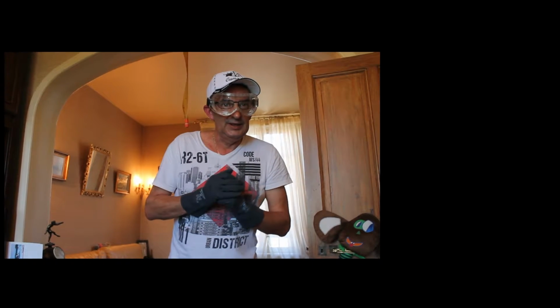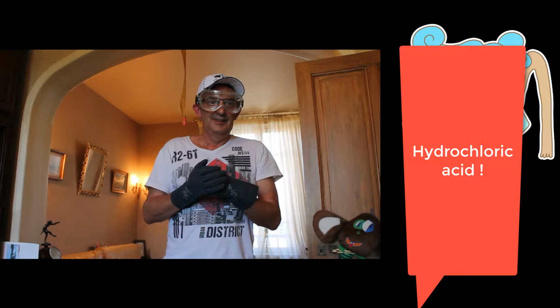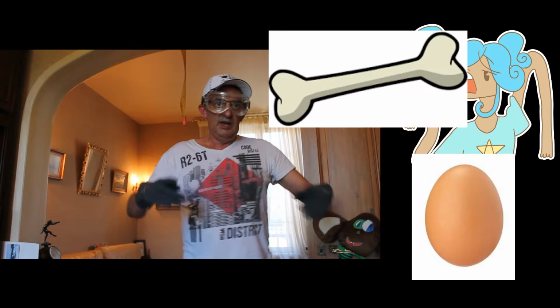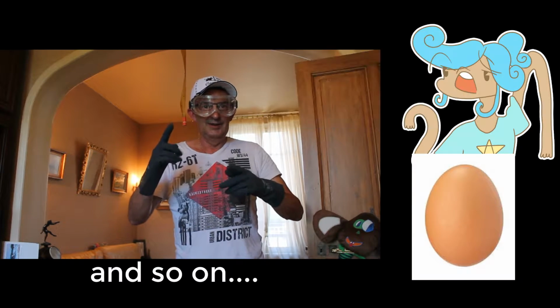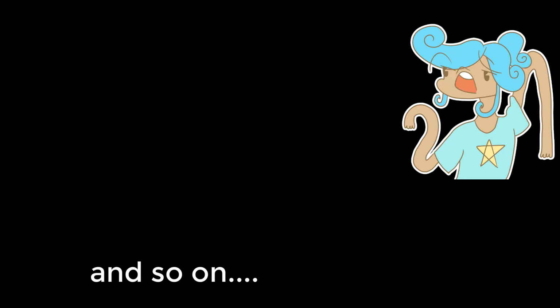Welcome to the Mad Scientist Lab. Today we're going to show you the effect of acid chlorhydric, which is what in English? Hydrochloric acid. Hydrochloric acid on different objects: bone, eggs, and so on. Let's get cracking.